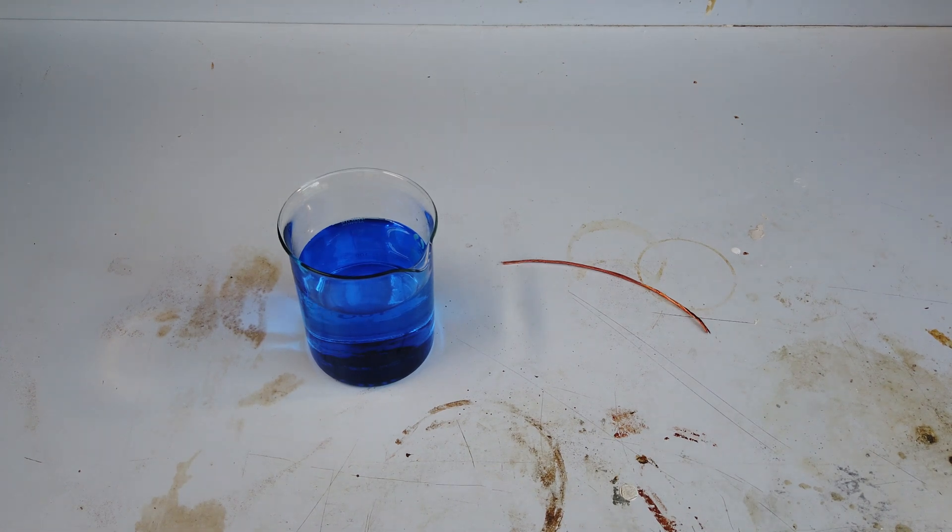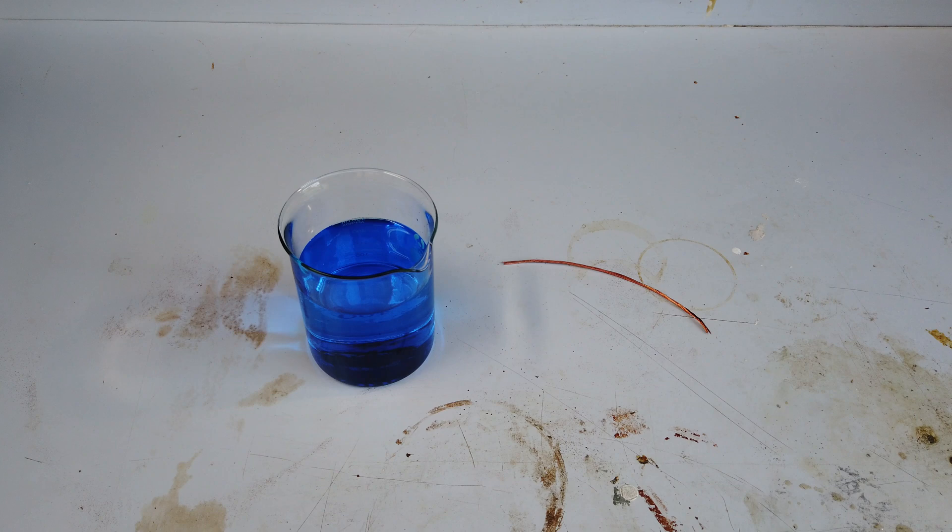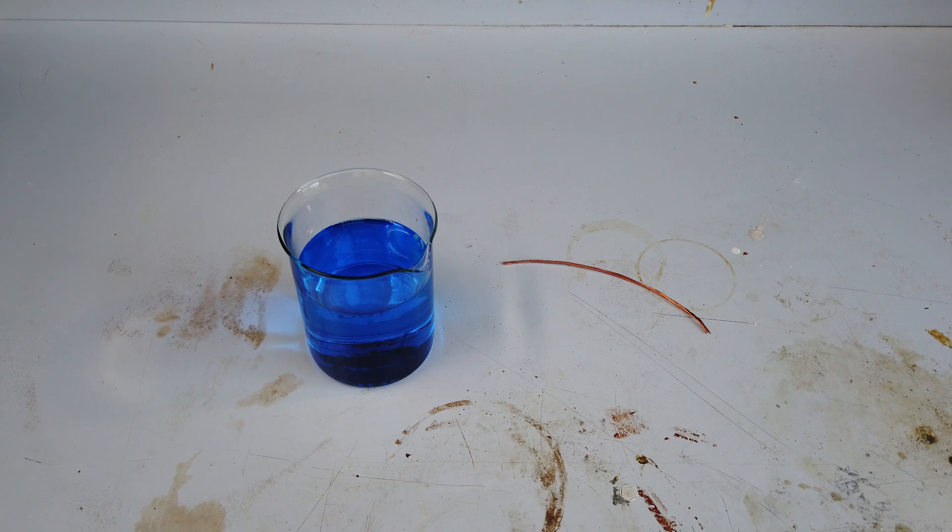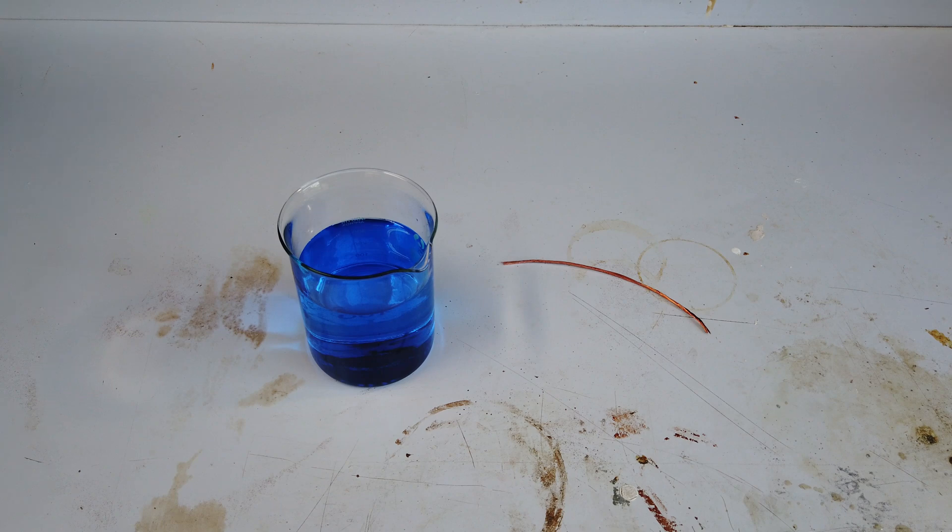In my search online I found a few people who have done a very similar experiment, but instead of running a high enough current to get big copper dendrites in a very short amount of time, they have done a very slow electroplating process of copper in order to get copper to grow in a very crystalline manner.